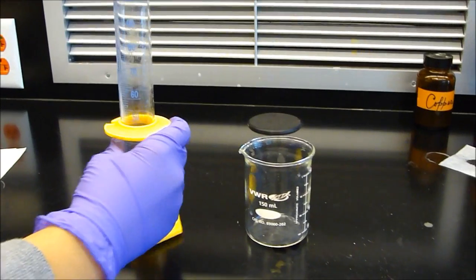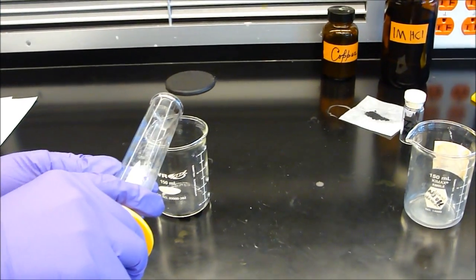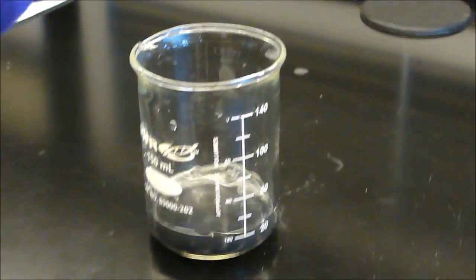Start by preparing the solid copper oxide in a beaker with hydrochloric acid. Because this lab requires 2 extra runs, it'll be more efficient if you work with both runs at the same time. This will give both the maximum amount of time needed, so it'll yield accurate results.